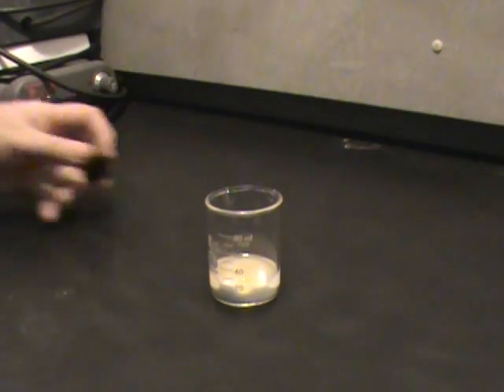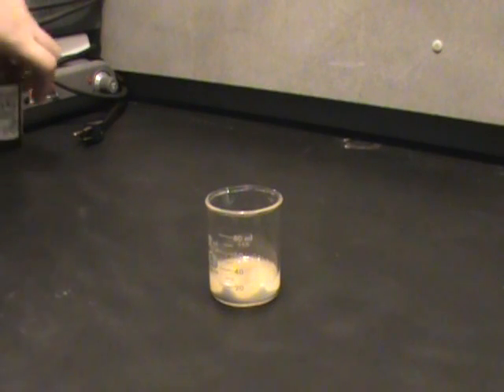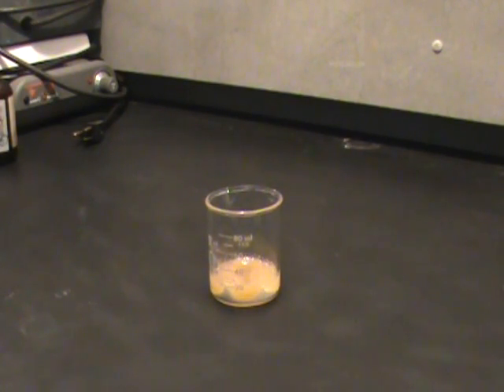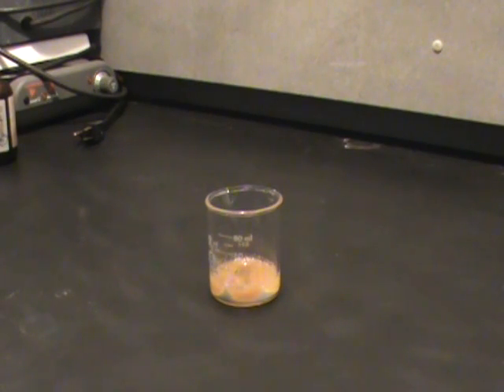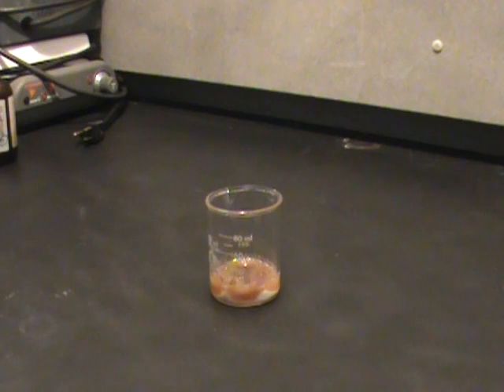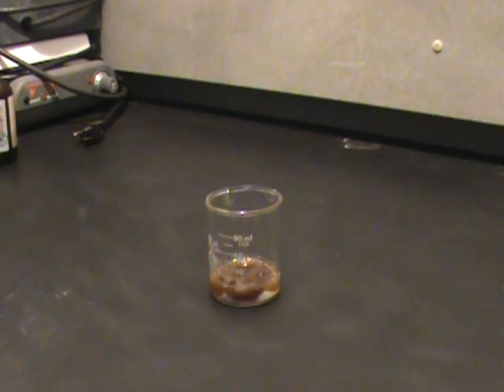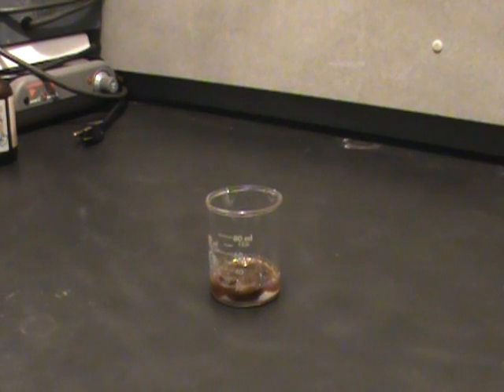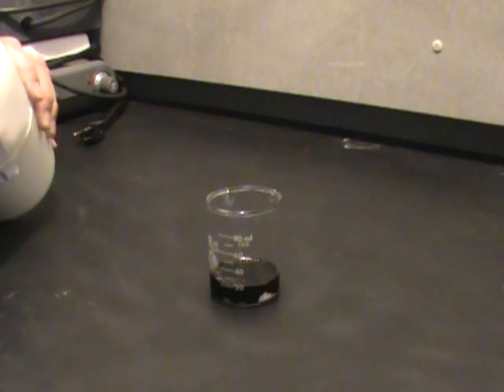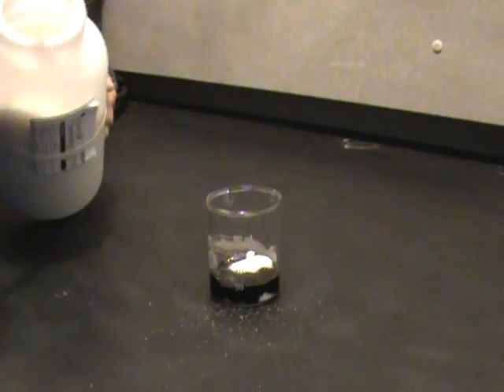So if you spilled that on you, would it just burn through you? Yes. And here's what the sulfuric acid is doing to the sugar — it's turning into caramel. It's caramelizing. So you definitely don't want to eat that caramel. There's a little excess sulfuric acid in there, so I'm going to put a little bit more sugar in to get this going.